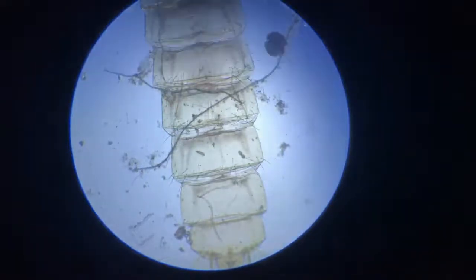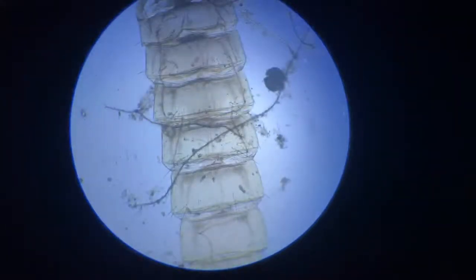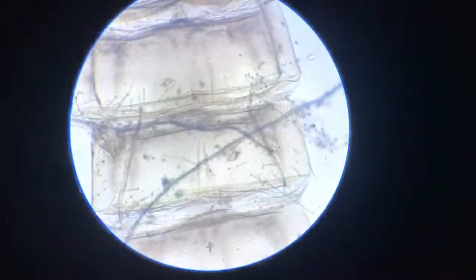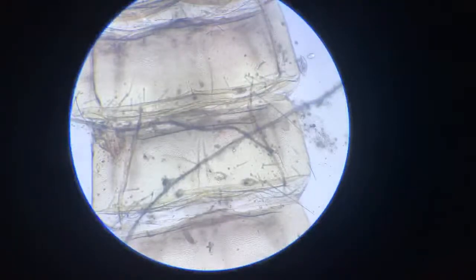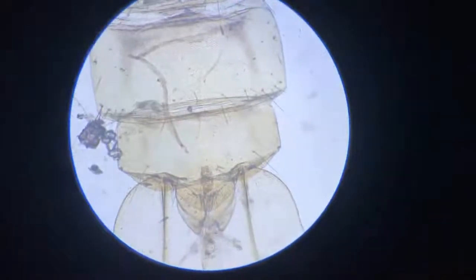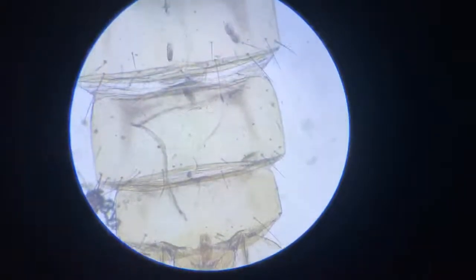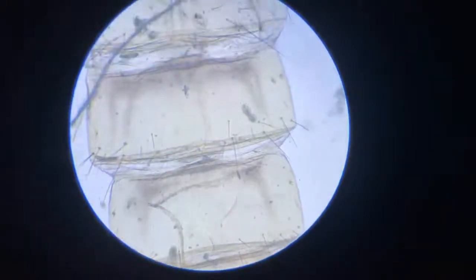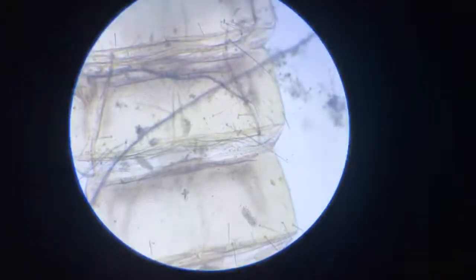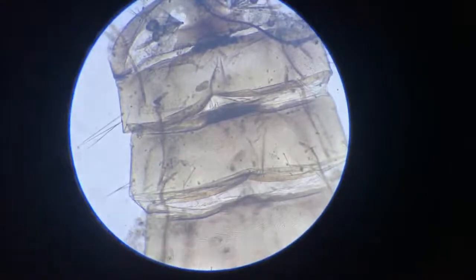In this building, I came across one section very interestingly wherein two euplotes are in conjugation. Now we are at 10x objective and 10x eyepiece. This entire body — the remains of this dipteran — has been converted into an apartment building by these various ciliates. We see a lot of paramecia, and we also find a few euplotes floating around, hovering from one section to another. And it is in this that there is a pair of euplotes.